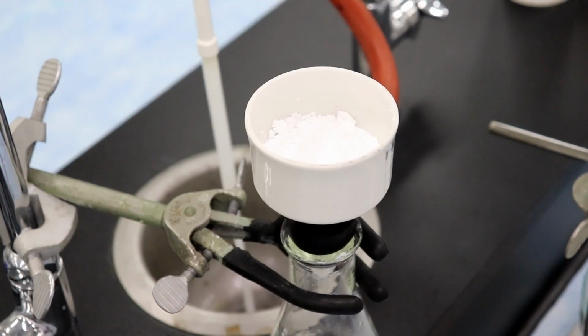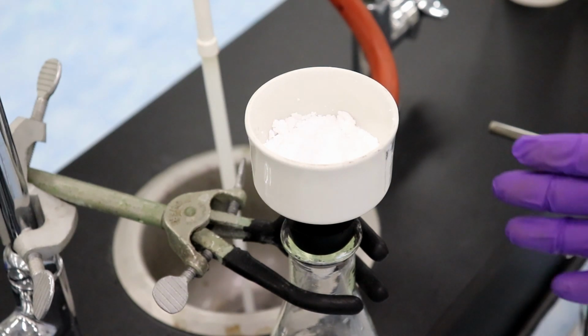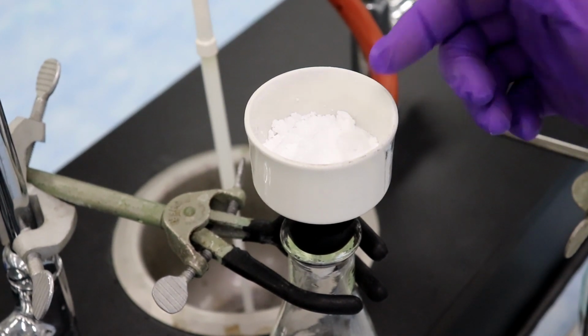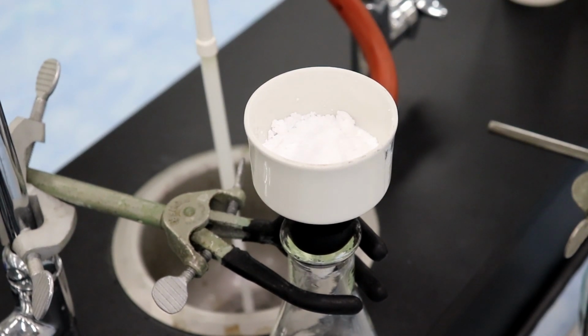Okay, so that looks good. Now the more water we pull off in this step, the less we have to worry about in drying it. And I'll show you in a little bit, but the bottom of the Erlenmeyer flask down here, you can check to see how much product we've lost and how cloudy it is. So it is a little bit cloudy, which means that we've actually lost a little bit of product. But you can just see the massive amount of white crystals we have up in here, which tells us that overall this is looking pretty good.